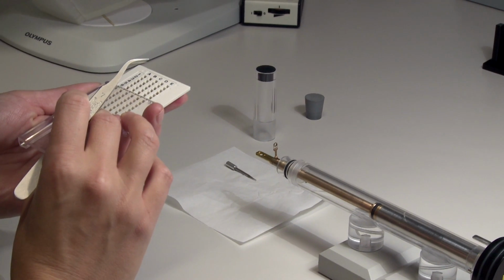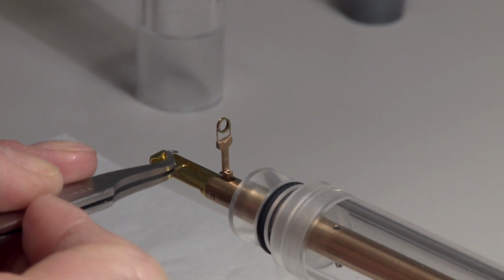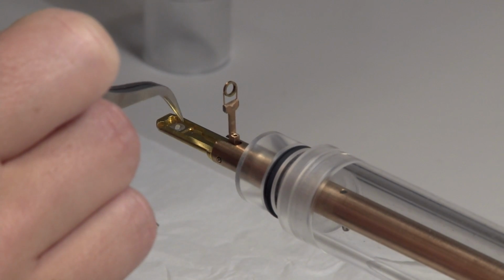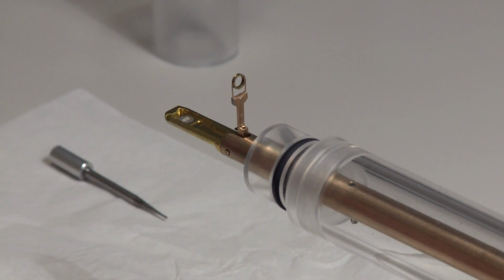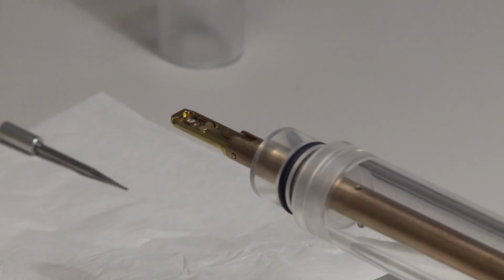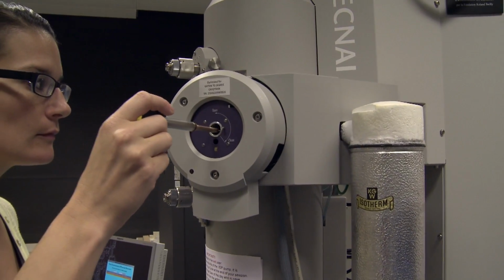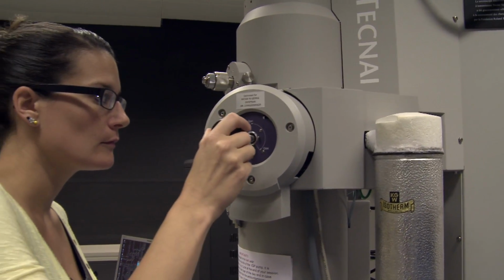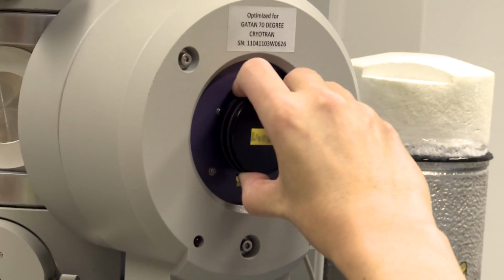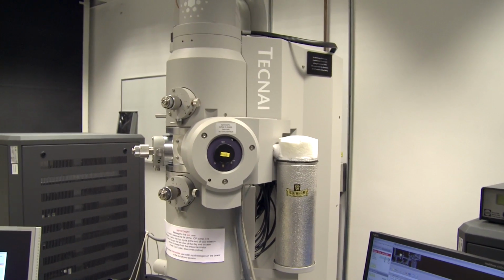What we can do is just have a quick look at how we do this practically in the lab, and look at a movie of Stephanie putting a sample into the electron microscope. First of all, we place the very small grid onto the sample holder. The grid is then clamped in place so that it doesn't obviously move in the microscope. This holder is put in at the level of the objective lenses. It's then put in place and then into a primary position where air is pumped out, and then it's placed right into the column of the microscope.